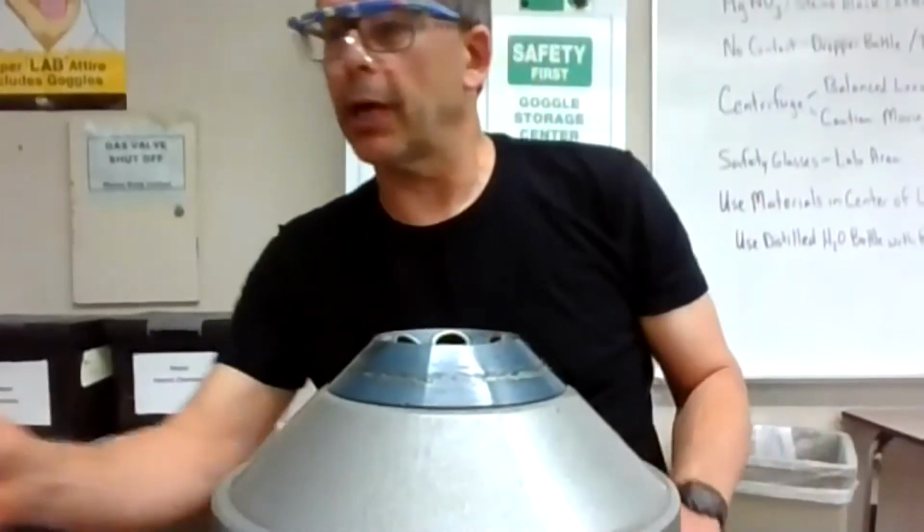Okay, maybe 2. Okay, move this up and down, and now it looks kind of hazy, but there's almost like bubbles in there. And hopefully you can kind of see the bubbles in there. And I think this is going to centrifuge out. It's almost like a gel-like thing. I can think of it kind of looks like fish eggs. I'm going to put it in the centrifuge, which I don't think you can see right here.